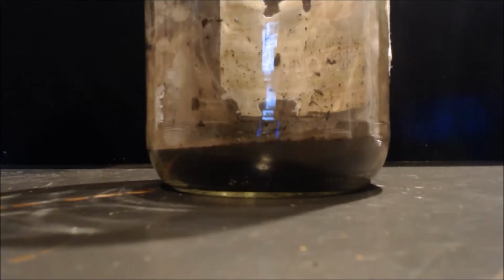So I put it in there, and I'm going to wait until I have all my experiments done with potassium permanganate, or at least until I get this jar halfway filled up, or at least a third of the way or something. Because you're going to lose a lot into the filter and stuff like that, and it gets a fine precip into the water when you clean it.